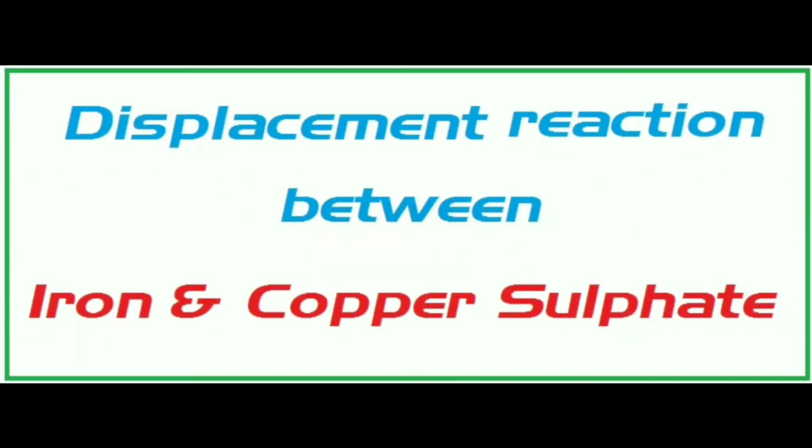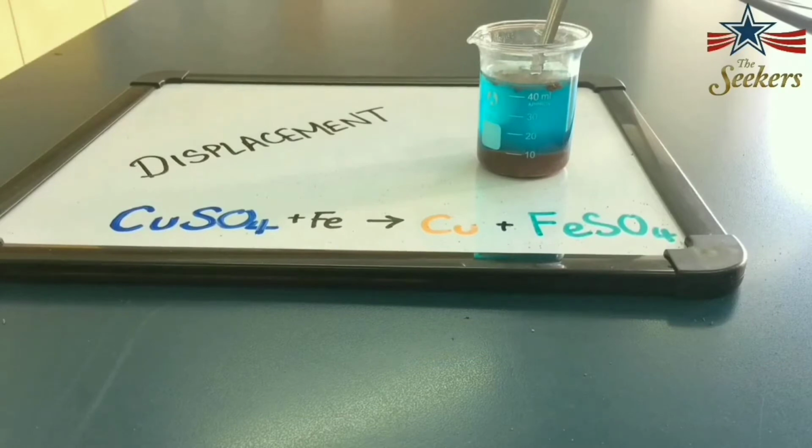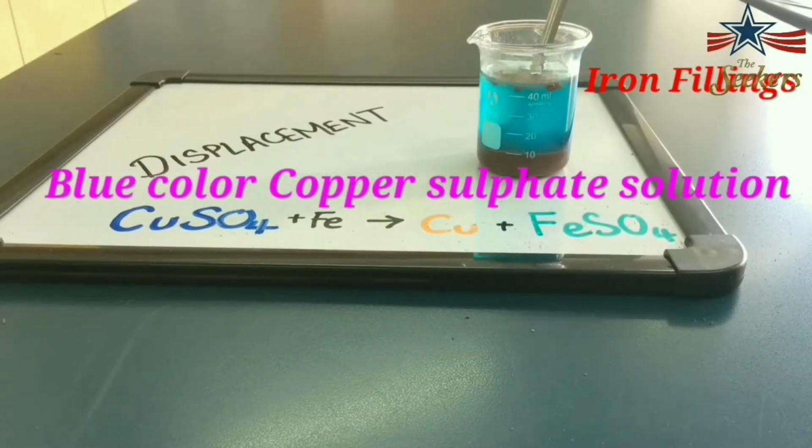Let's see another example of displacement reaction between iron and copper sulfate. You can see the blue solution of copper sulfate in the beaker. When we add some iron filings in the beaker, chemical reaction starts.